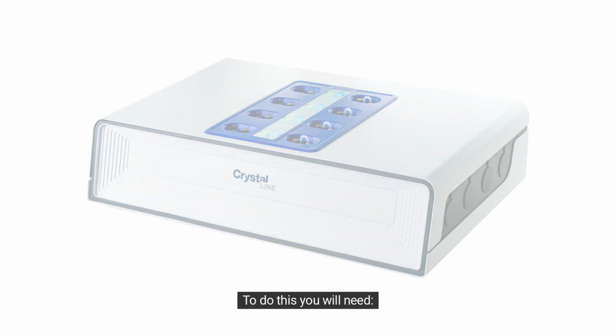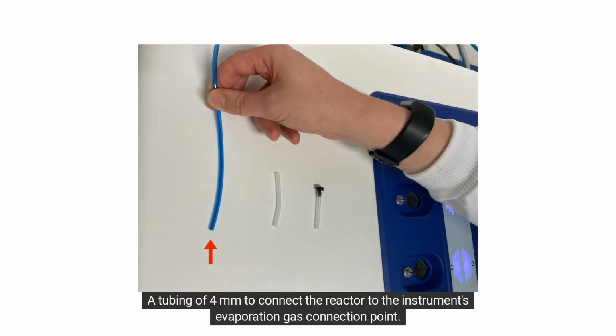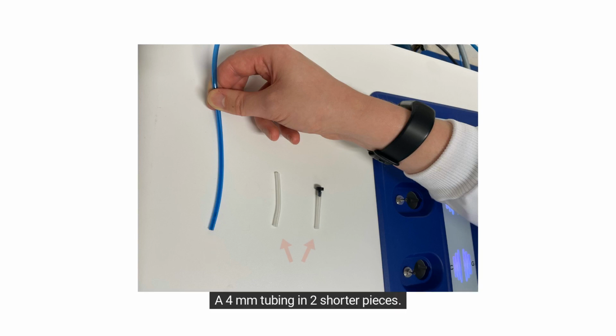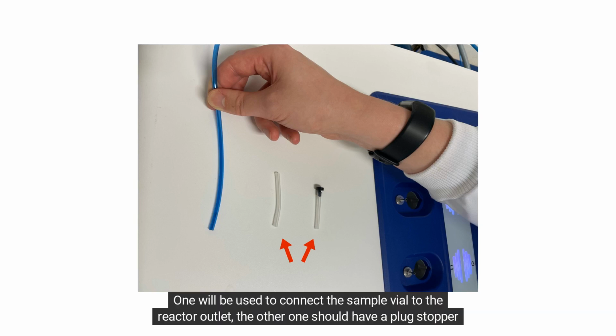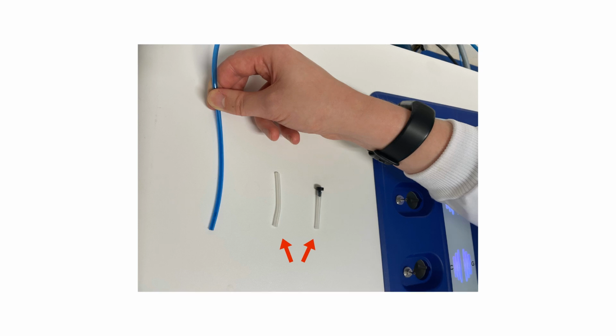process. To do this, you will need the evaporation gas connection point, which can be found at the back of the instrument, a tubing of 4 mm to connect the reactor to the instrument's evaporation gas connection point, and a 4 mm tubing in 2 shorter pieces. One will be used to connect the sample vial to the reactor outlet. The other one should have a plug stopper to prevent the gas from escaping during the experiment.